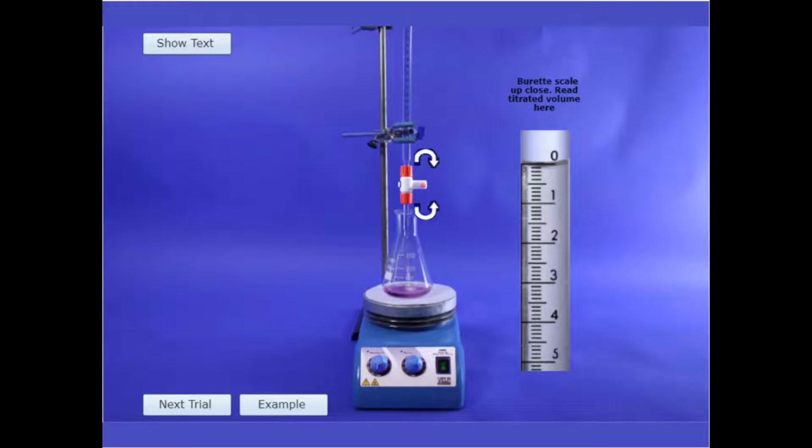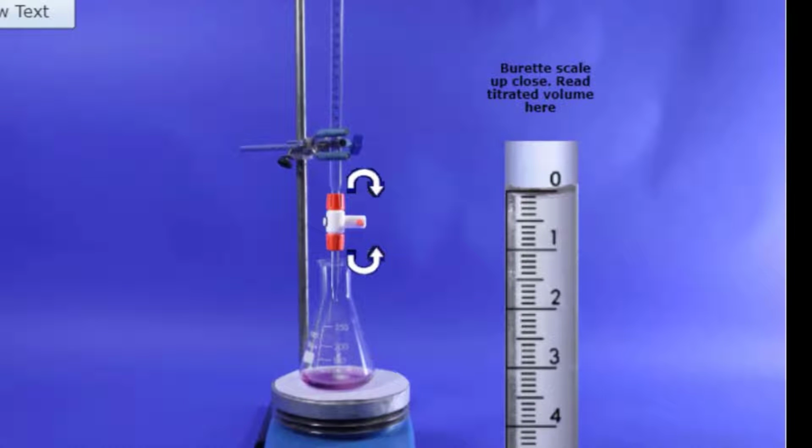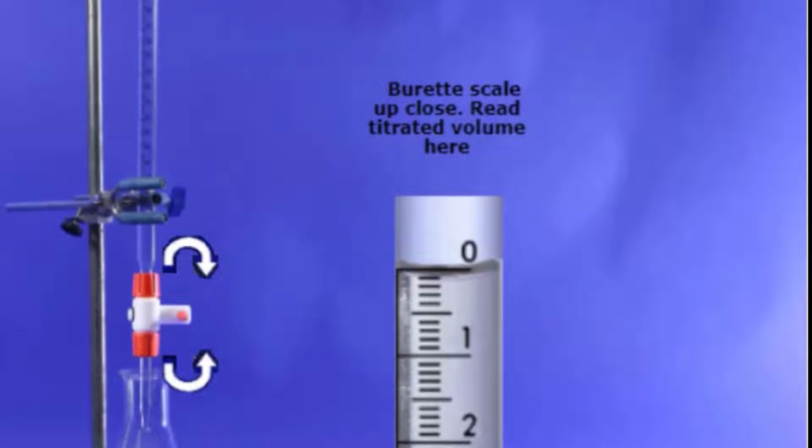Once you have selected all the glassware and solution needed for this experiment, you will move on to the actual titration. The burette containing the EDTA has been clamped to a retort stand above the conical flask containing the prepared sample for analysis. To allow you to read easily the volume of the EDTA used during your titration, a zoom-in view of the burette graduated scale is displayed on the right-hand side.